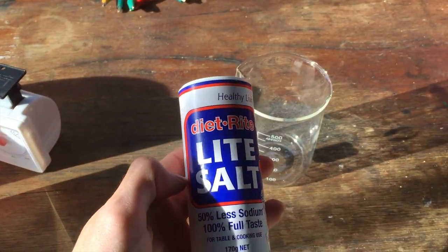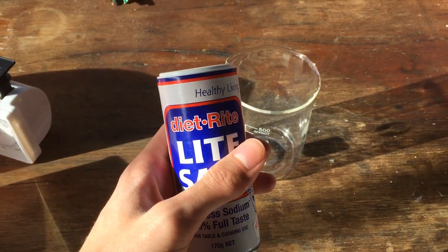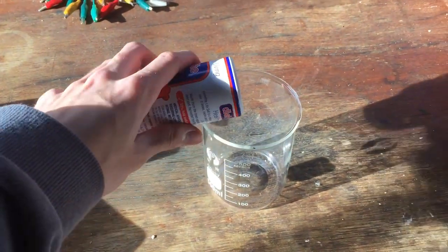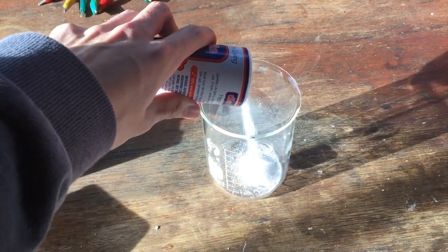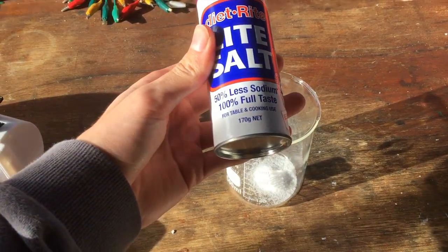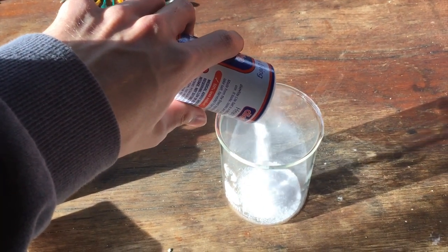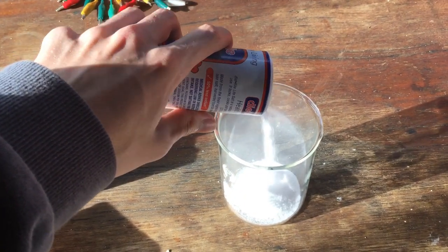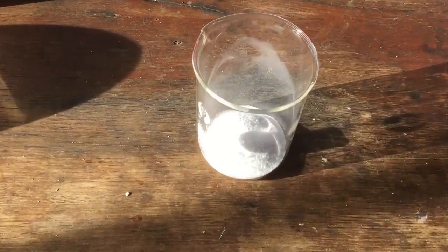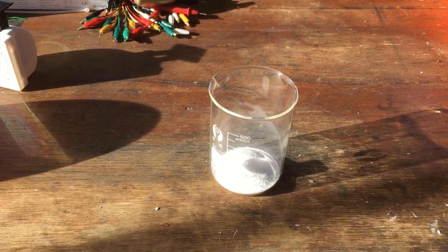This is just in case something goes wrong — we haven't used 100% of our chemical. I don't think anything will go wrong because this is a pretty easy process, but I think it's good to do that anyway. So we'll get around 170 grams in here, meaning we'll get 85 grams of our potassium chloride and sodium chloride mixture. And there's approximately 85 grams of our salt mixture ready to go.